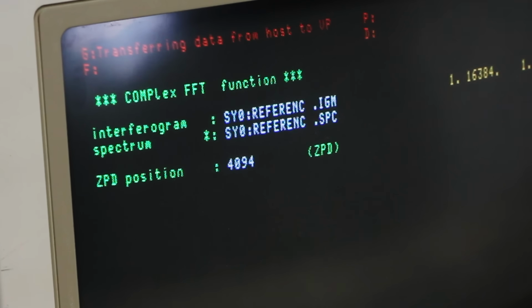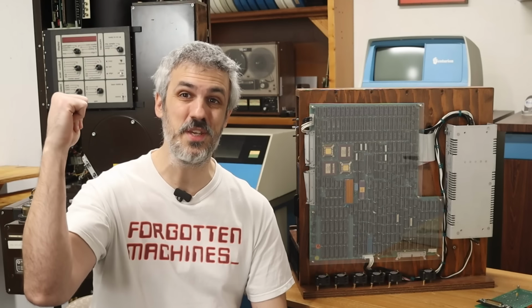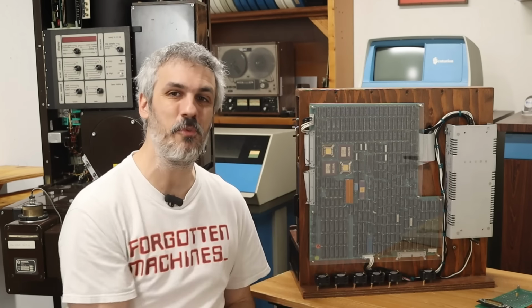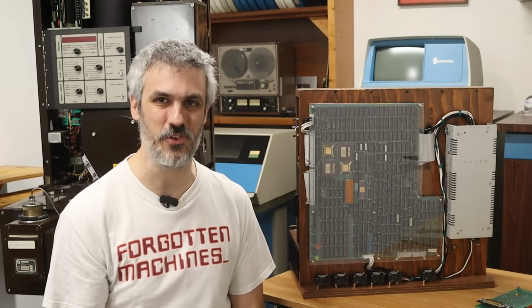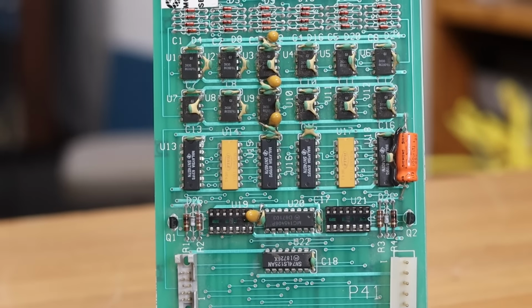Now, I have done a couple of FFT calculations using this, but I've only done them on interferograms that were already stored on the hard drive. I wanted to take a new interferogram using the Bomem DA-3, send it over to this high-performance vector processor, do a fast Fourier transform on it, and see the spectra that's coming out of it. And we're going to use this little board right here to do that.